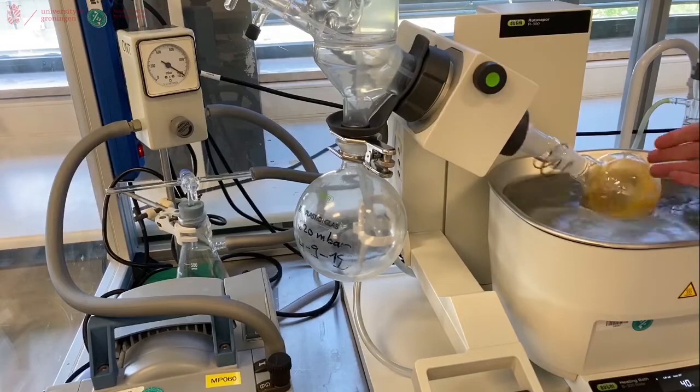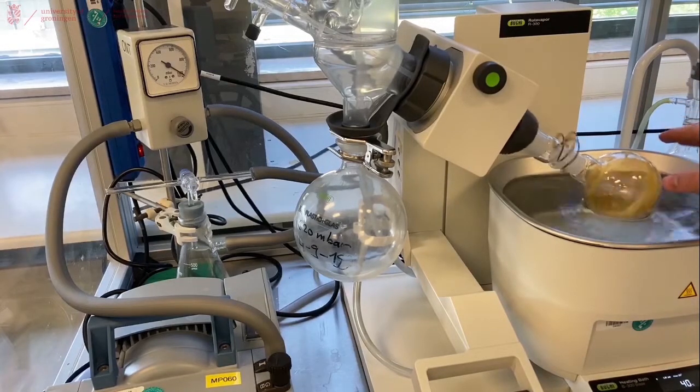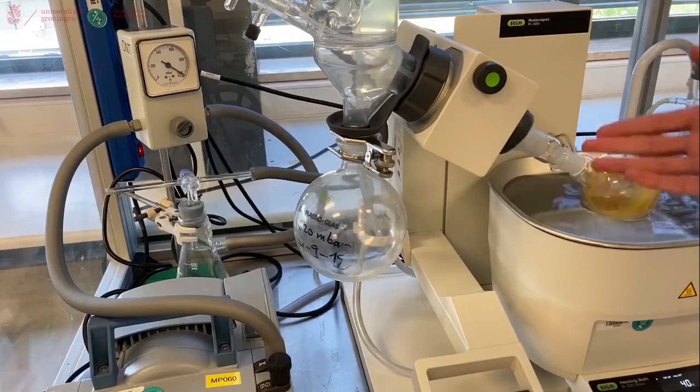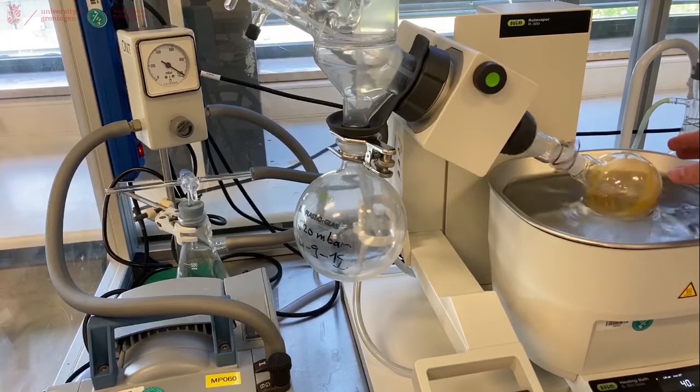When using the Rotary Evaporator, you want to make sure that your solid is completely dry. So when everything is gone, we will place the Rotary Evaporator on full vacuum for one or two minutes. To make sure that every residual solvent has been removed.